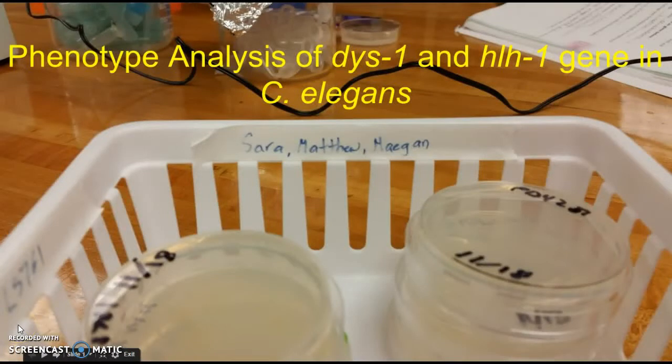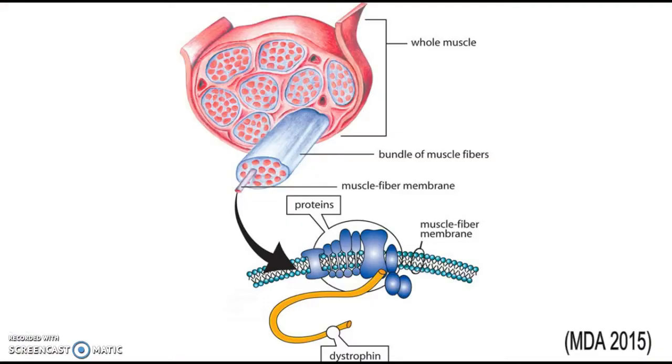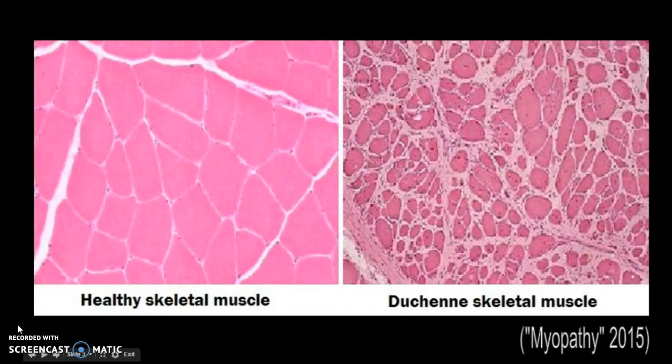Our experiment was a phenotype analysis of dys-1 and hlh-1 genes in C. elegans. The dystrophin protein is located under the sarcolemma, attached to an actin filament. It is found in skeletal and cardiac muscle. Dystrophin is a protein that is mutated in genetic disorders such as Duchenne muscular dystrophy and Becker muscular dystrophy.